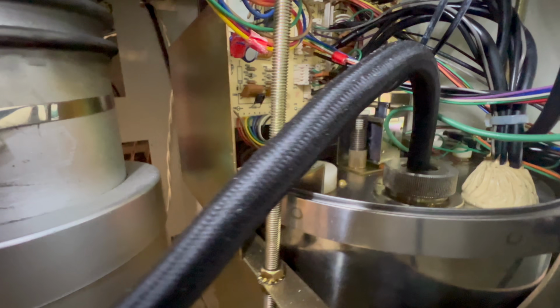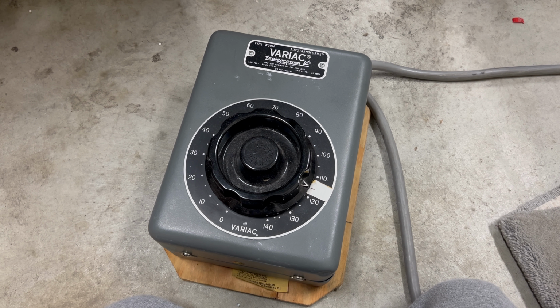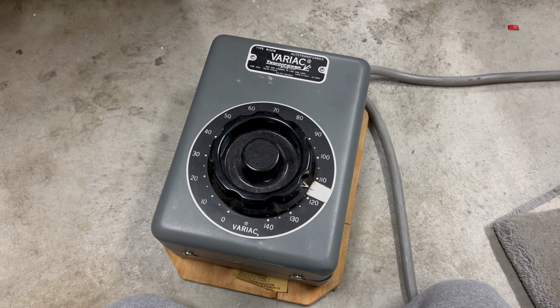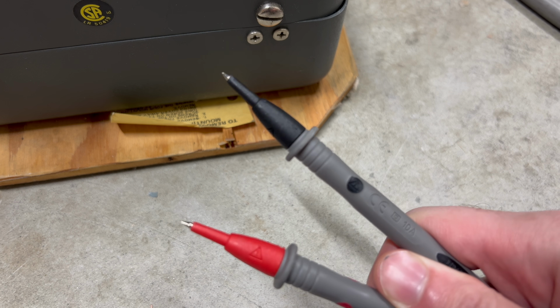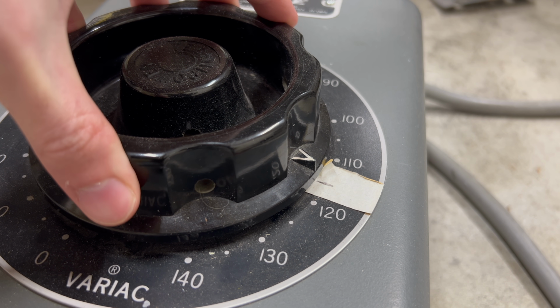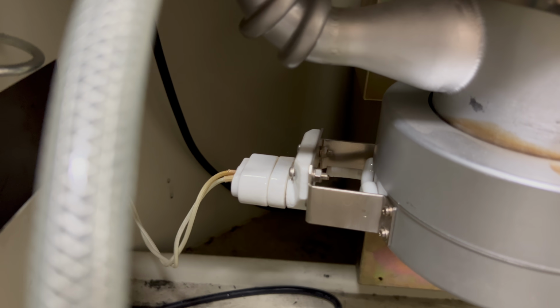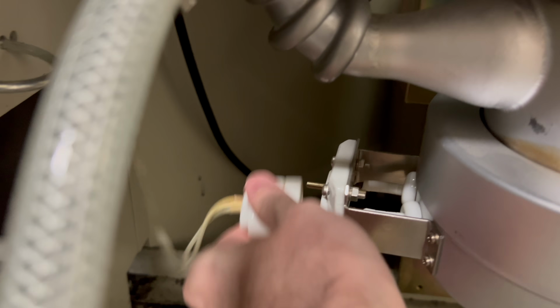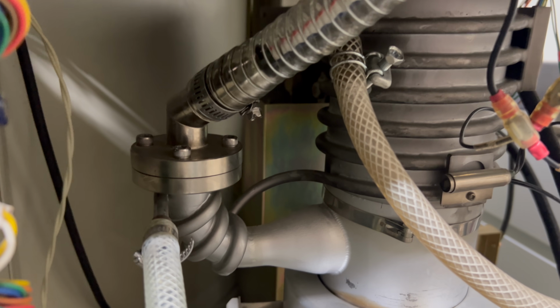But how do we actually repair this thing? Well, given that it won't currently turn on, it makes sense to check out the power supplies first. This machine runs on 100 volts AC, which is provided by this variac here, which plugs into a standard 120 volt wall outlet. I first checked the variac and confirmed it was outputting 100 volts AC before connecting it to the machine. While I'm back here, I'm also going to unplug the diffusion pump heater. The diffusion pump requires a constant source of cooling water and vacuum and isn't necessary for the upcoming tests.